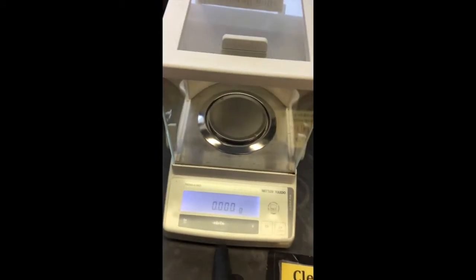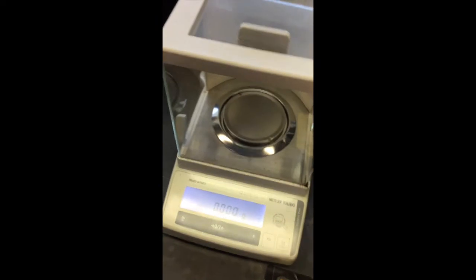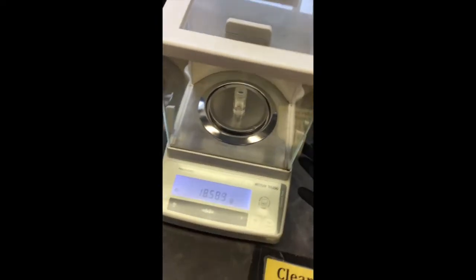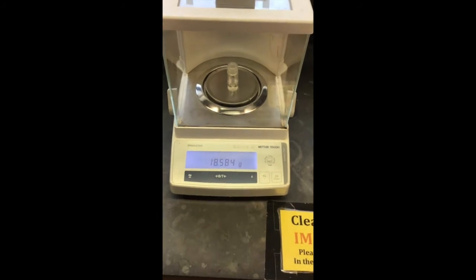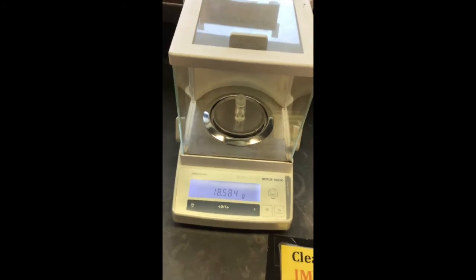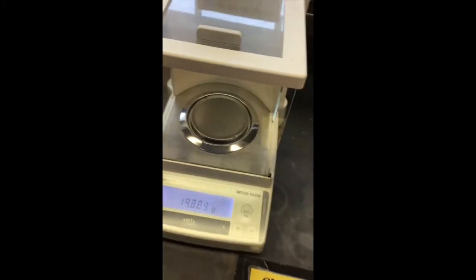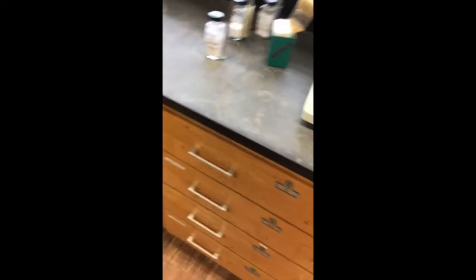Now we're going to weigh the pre-weighed conical vial to get its mass before we add the methylene chloride extract. That's 18.584 grams for that conical vial before we add the methylene chloride containing the benzoic acid.